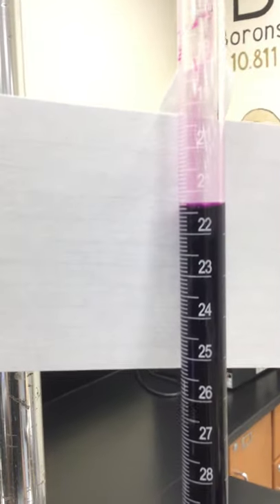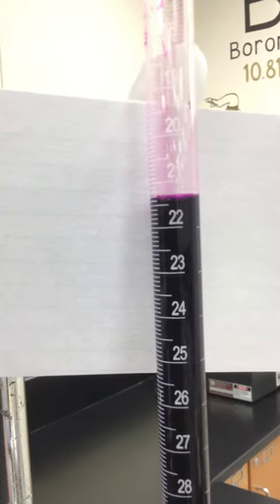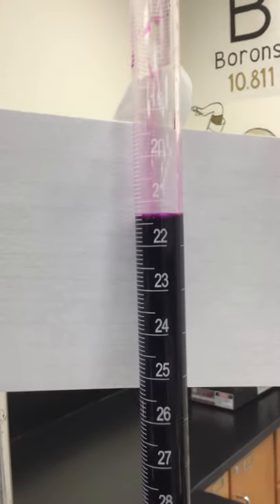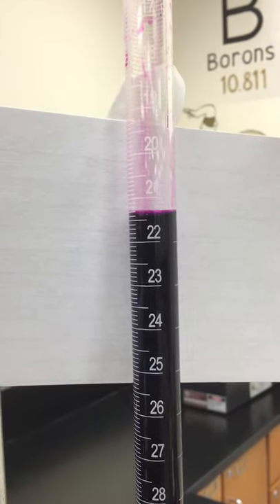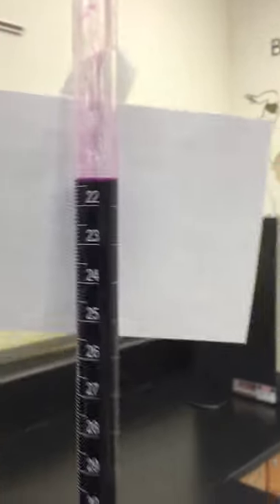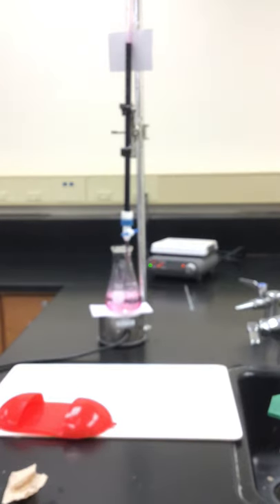All right, there's our new volume. And now we're going to use that data to figure out how much Fe plus two must have been in the flask when we started. Good luck.